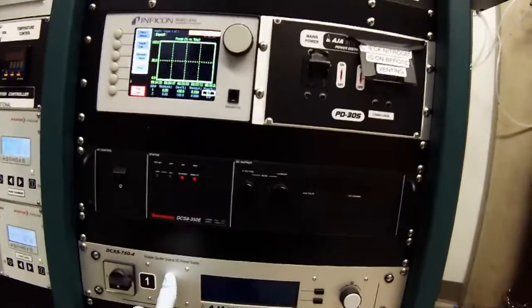This is the DC power supply for the sputter. There are two types of sputtering: DC and RF, which is basically AC at an RF frequency. DC is for conductive targets like gold, silver, platinum, and palladium. RF is for sputtering insulators like silica, aluminum oxide, and other materials that don't conduct electricity well. If you use DC on an insulated target, charge builds up behind it, heats it up, and causes it to melt.